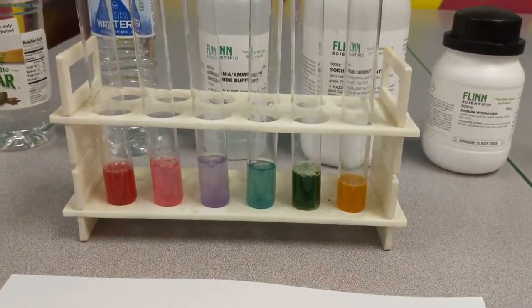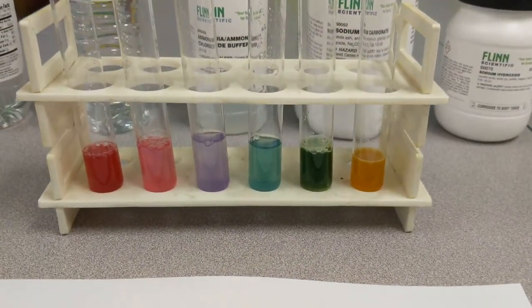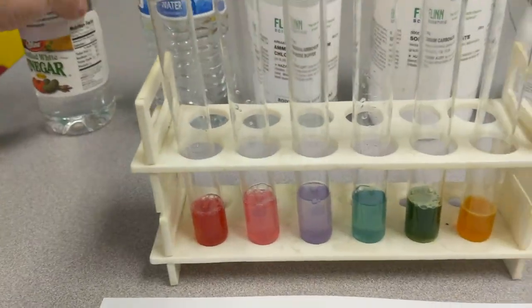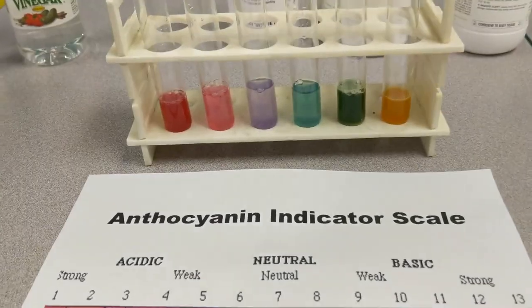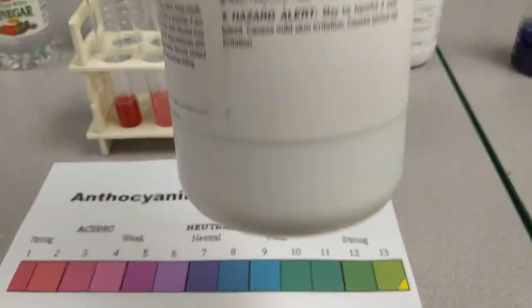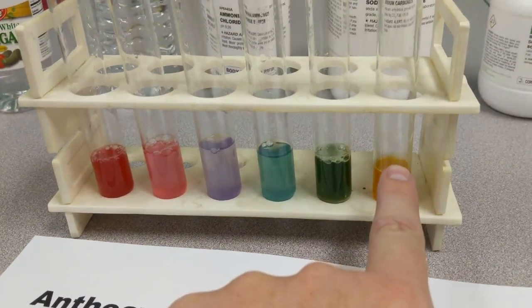Let me explain a little bit more about what I'm doing. I topped some of them off so the levels would be more equal and you could see the colors better. I also swapped some things around — so now the order from left is: hydrochloric acid, then vinegar which is the pinker one, then water. Then I added ammonia to this one. The last two are sodium carbonate and sodium hydroxide — I added a little more of the sodium hydroxide because that yellow color is really cool.